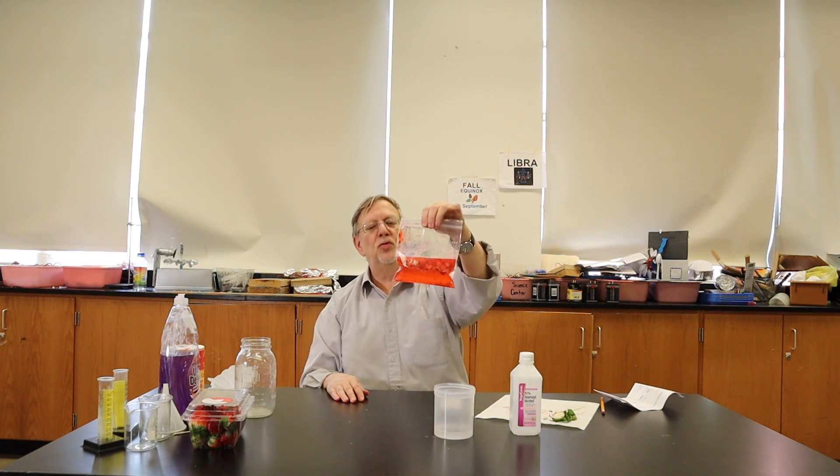Okay, now we have waited a few minutes, letting the detergent and the salt do their work. We have got sort of a strawberry mush in here. And we are going to pour it into a bottle. But we are trying to remove all the solid pieces. So we are going to filter them out by using filter paper.